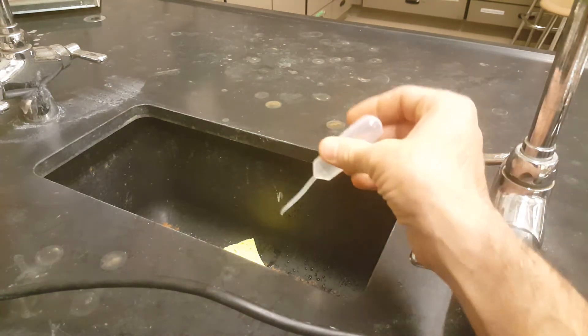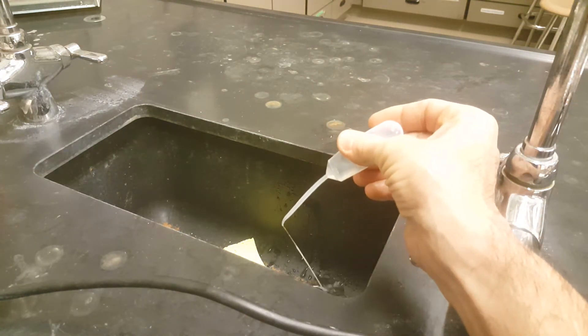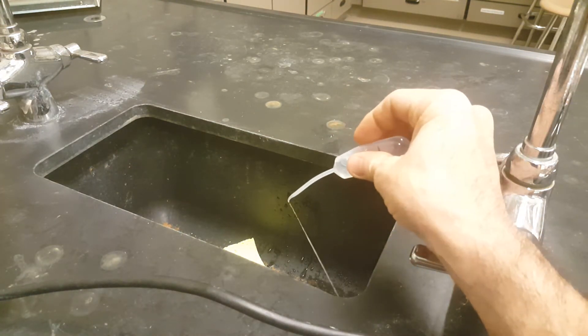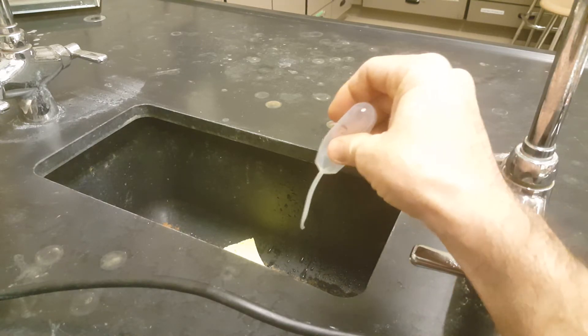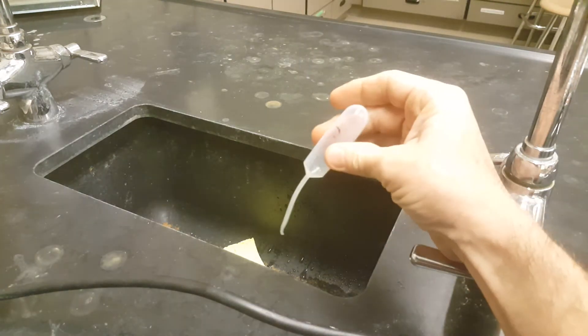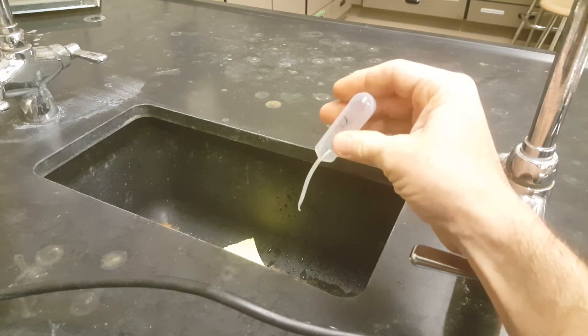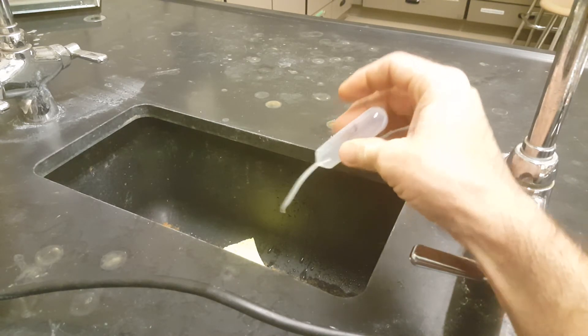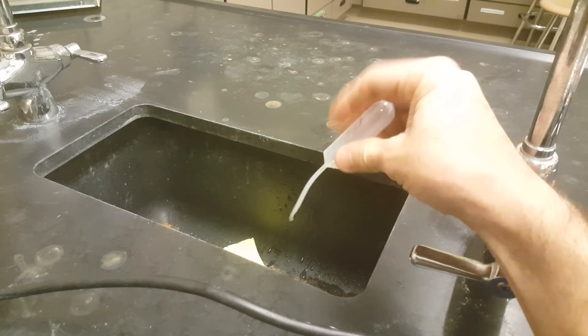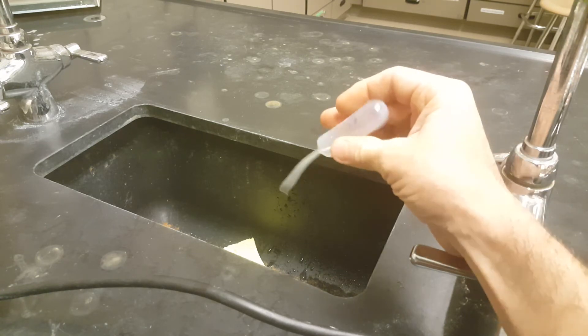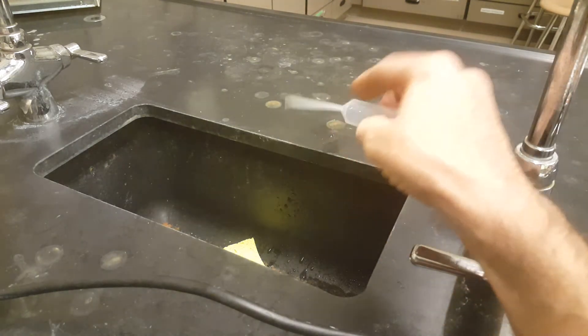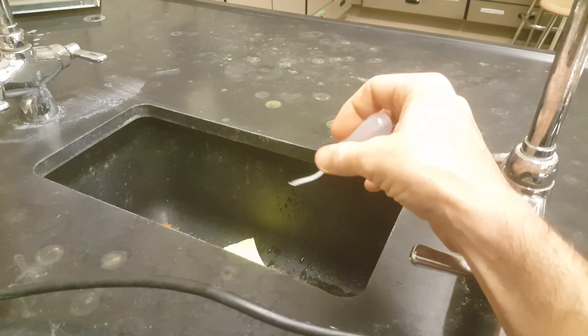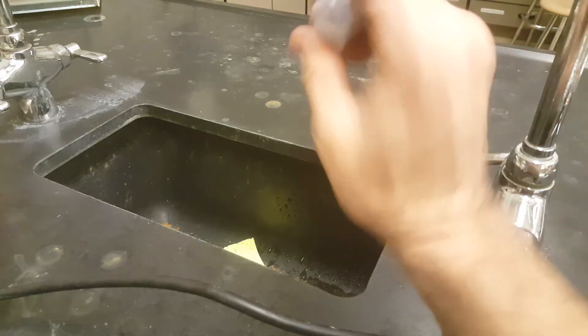Repeat all of those steps for all three of your pipettes and then empty your water into the sink. Make sure all the water is out. If you feel like there's too much water left behind, then you can add some acetone to this at the end of the day. Shake it up, squirt that out and it'll help to carry some of the water out of there.